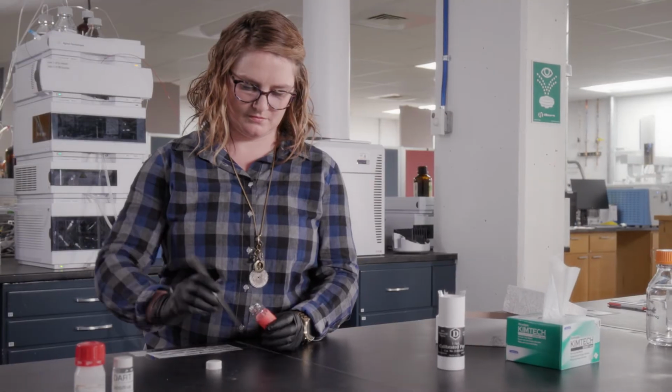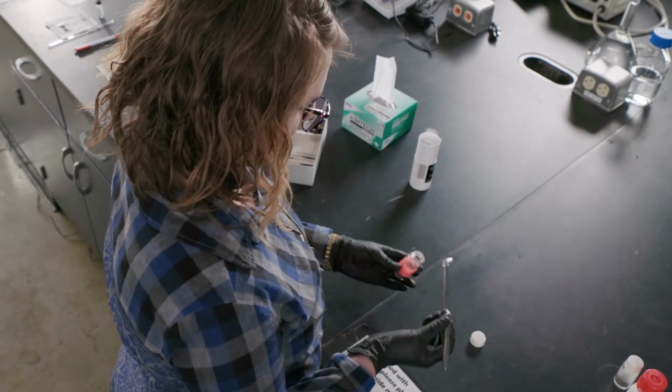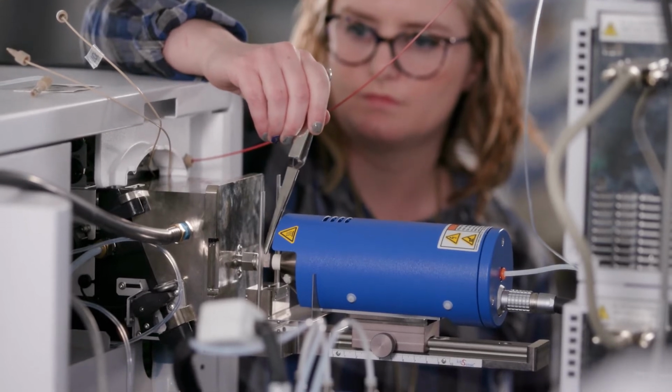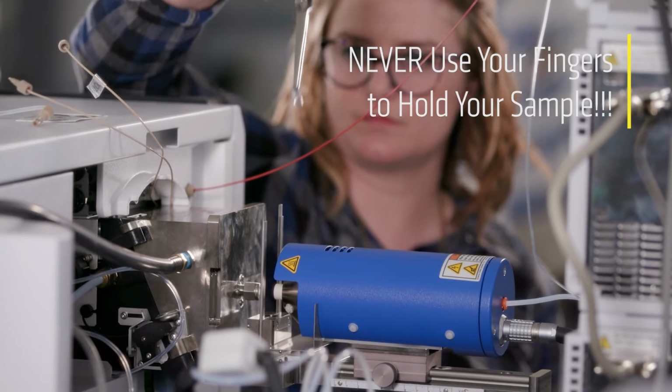If you are using DART to measure directly from the surface of a solid material, you can either try mounting your sample to an open spot card, or you may need to use tweezers to hold your sample in the plasma beam. Never use your fingers, as the plasma beam is extremely hot.